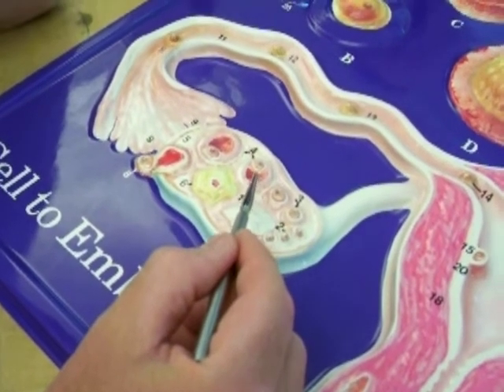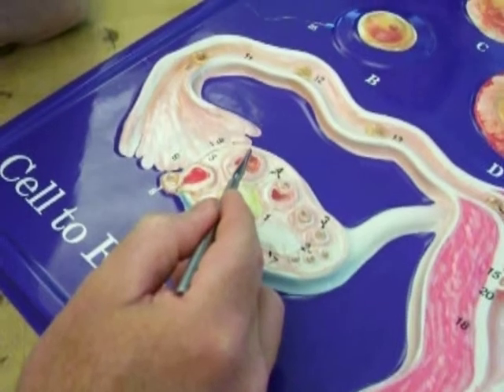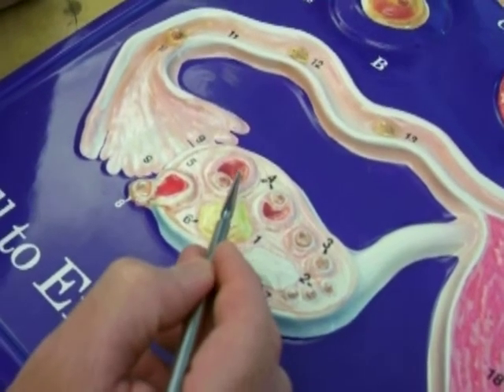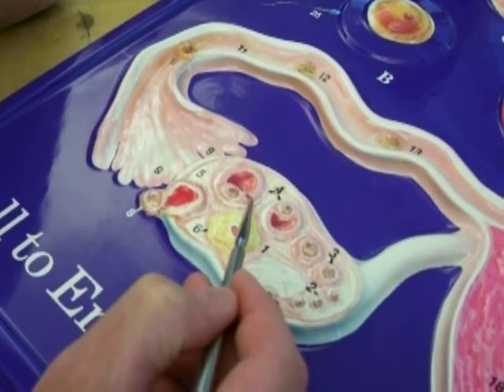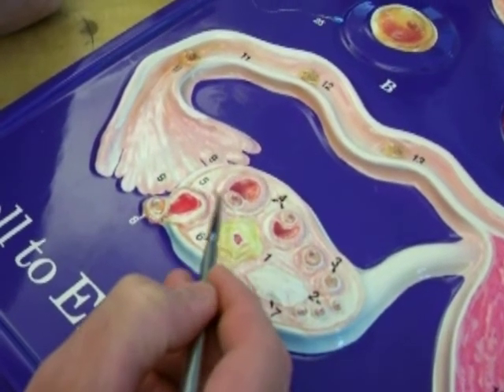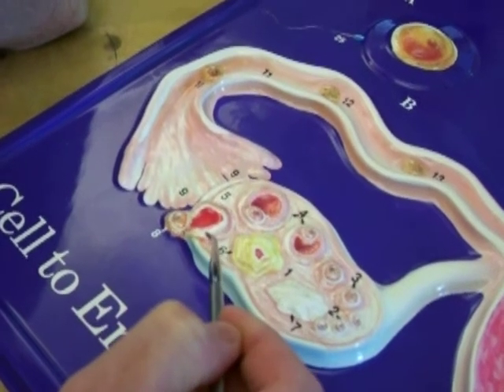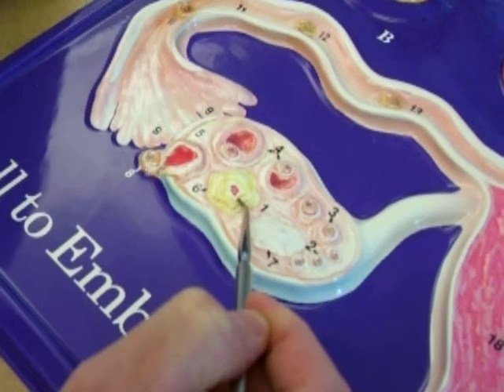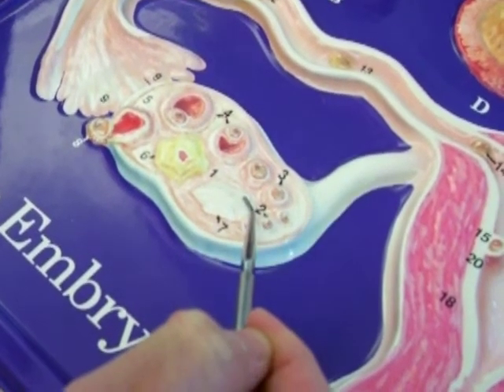The antrum will increase in size, such as this. See how it's increasing, and the follicle gets closer to the periphery of the ovary. This is a mature or Graafian follicle. You can see the oocyte here with some cells surrounding it here and here. You can see ovulation took place. Some cells were left behind. They will form the corpus luteum, and if you don't have implantation occur, it regresses to a corpus albicans.